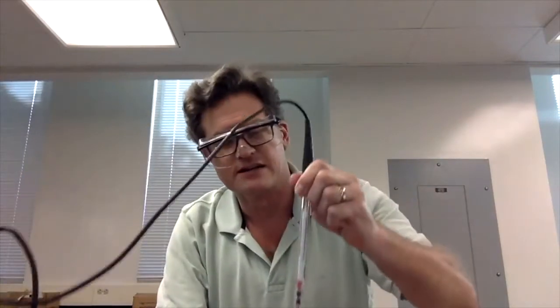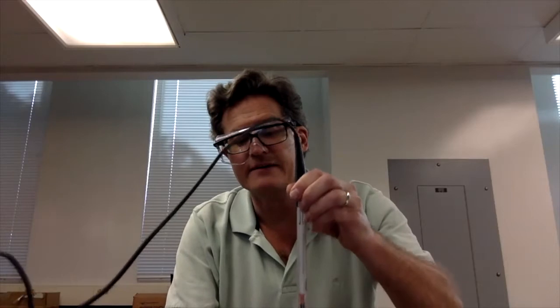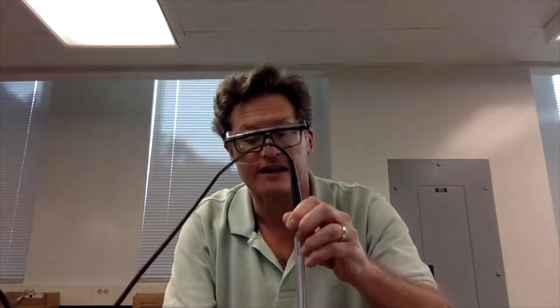Because you're going to stick this in here. It's all nice and clean up. And stick this in here. We're going to let the reading stabilize. It takes a little while, 10 or 15 seconds for it to stabilize. Then we're going to make that reading. We'll write down our number, right? And then we're going to do that a couple of times to make sure we get the right reading, right? And we're going to do our statistics on that, right?